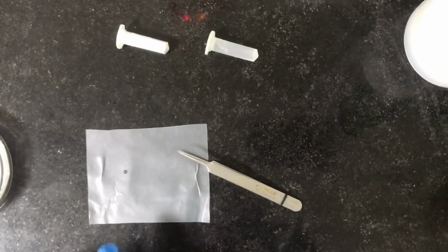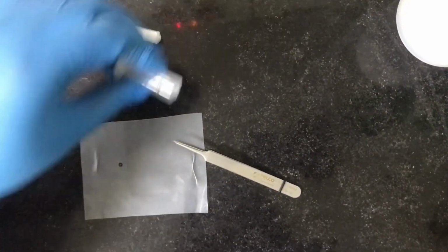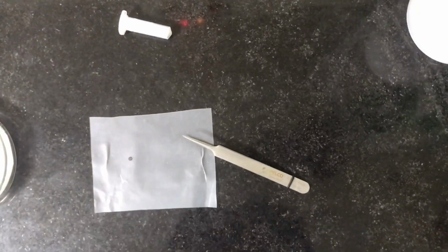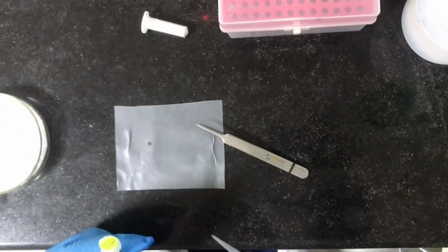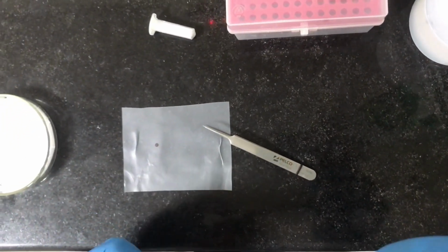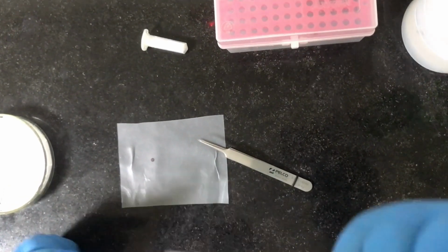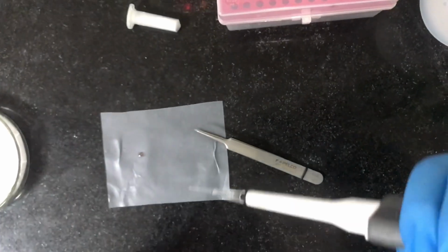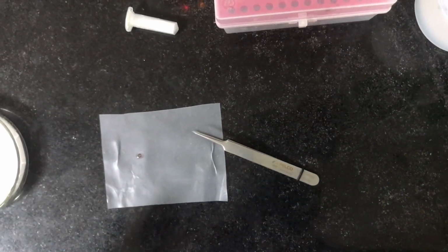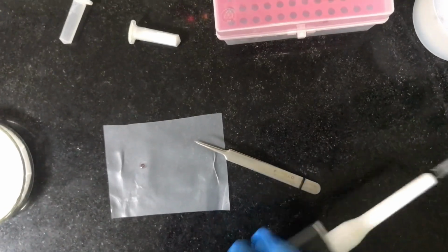Now let us stain and prepare the sample for TEM viewing. This is the dispersed sample in alcohol. We take a fresh tip and then we take a drop of the sample, and on the parafilm you can see is a carbon coated copper grid with the carbon side on top. We are putting the sample and then we are leaving it for a few minutes for it to dry.